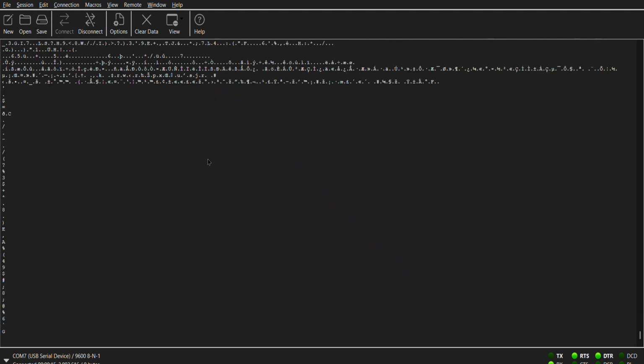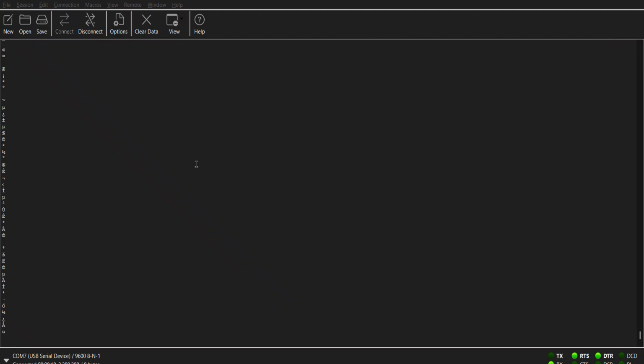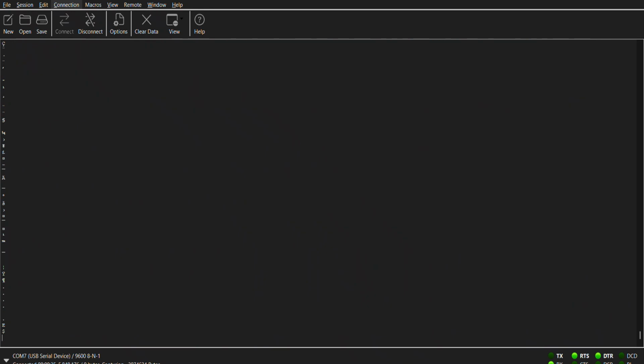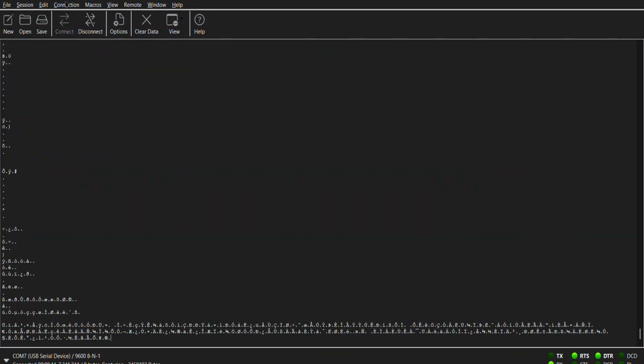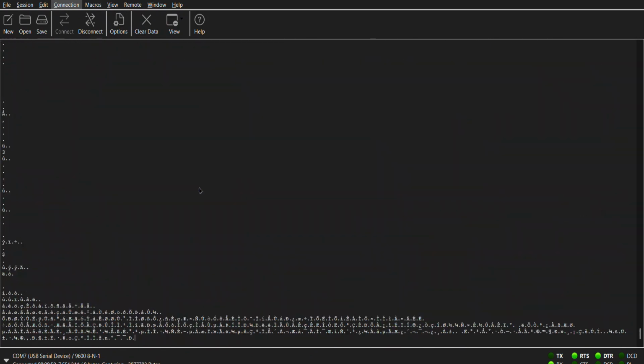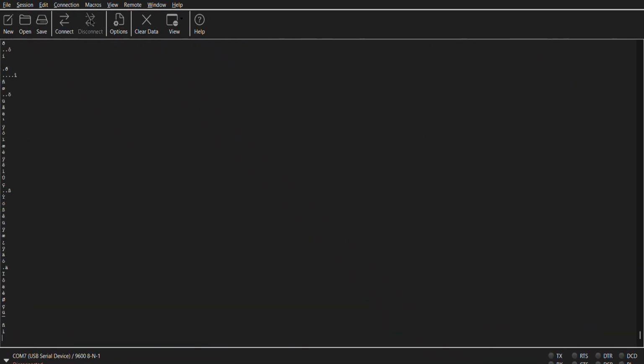The flashlight is then added above the CCD as I put my finger at the center, which we'll see in a second once the data is transferred. Here we're stopping the recording of the data. Next I'll convert it in the Python code, and you'll be able to see my finger show up over the center of the CCD once this raw binary data is converted into integers and a text file, which will then be shown in Excel in the form of a graph, where you'll be able to see each frame. So we disconnect here and close the terminal.